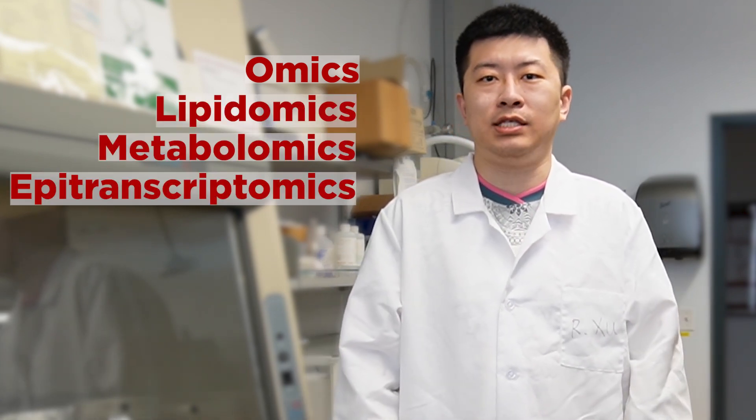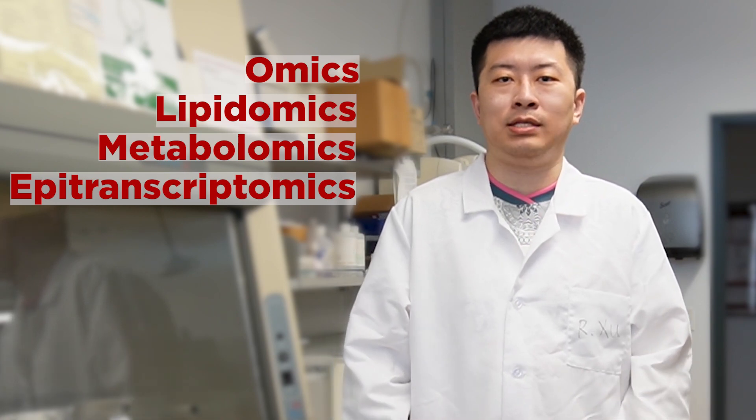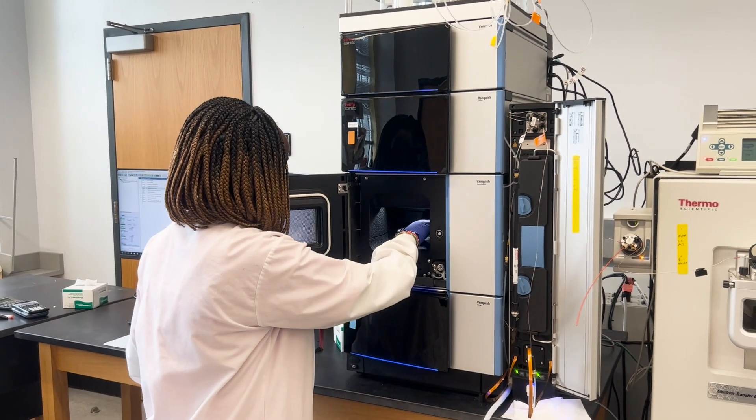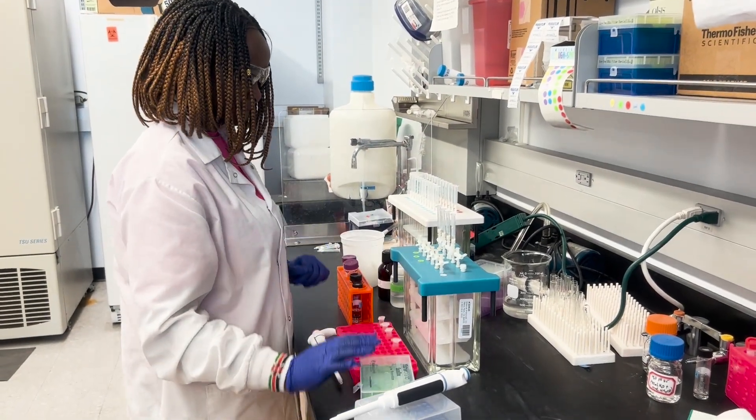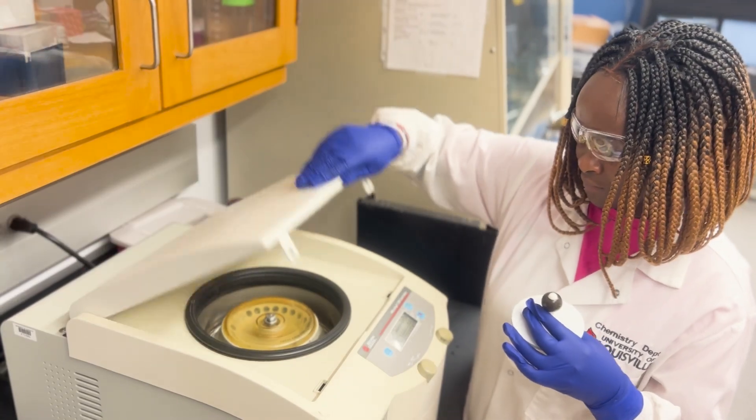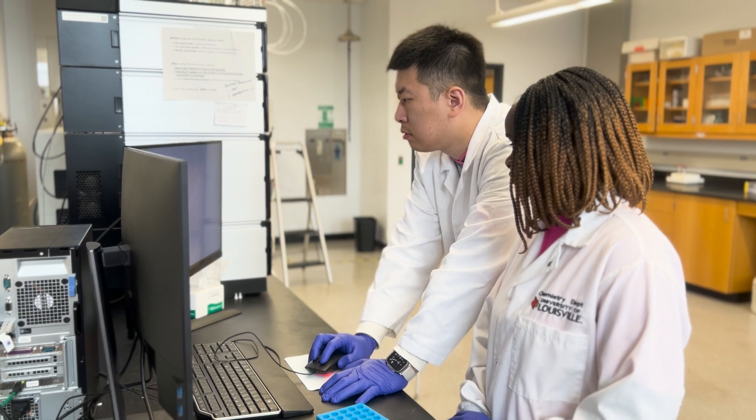In our lab, we mainly do omics studies including lipidomics, metabolomics, and epitranscriptomics using gas chromatography mass spectrometry and liquid chromatography mass spectrometry techniques. We apply the mass spectrometry technique to reveal the secrets of the molecules in all kinds of samples including human plasma, serum, or body tissues. Today, I will demonstrate how to extract the long chain fatty acid from the human plasma sample and show you how we analyze the long chain fatty acid on our mass spectrometry platforms.